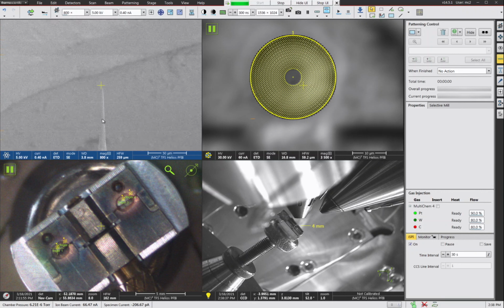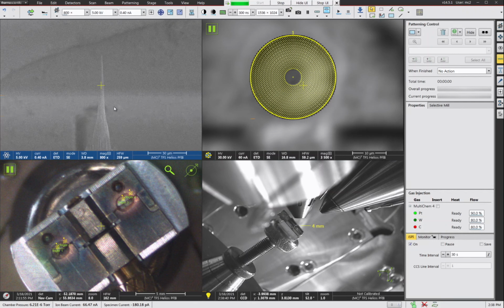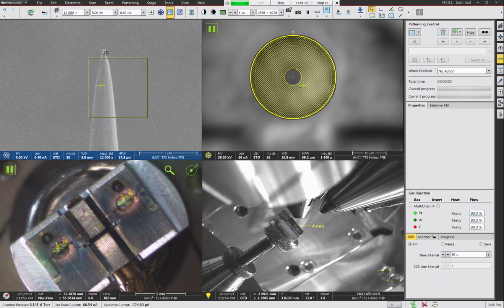And now we have a much more refined shape here on our post. Now the last thing we need to do is we're going to be lifting out a sample and setting it on the top of this post. And if you cut the post using the steps I'm showing you, you're likely going to end up with a fairly sharp spike at the top. That's not easy to attach anything to. So what we want to do is to chop this off so it's got a flat top on it. And that makes it behave like the conventional flat top silicon post that you can buy from Cameca.